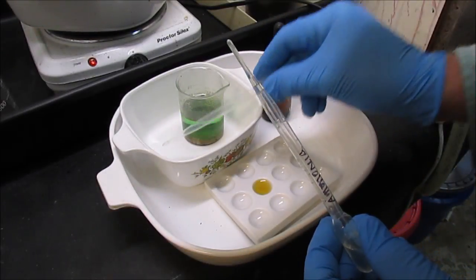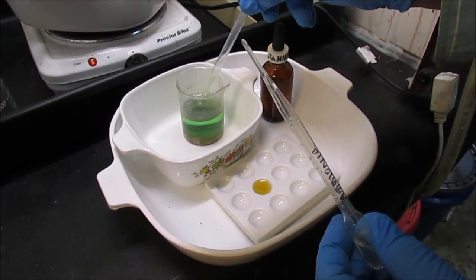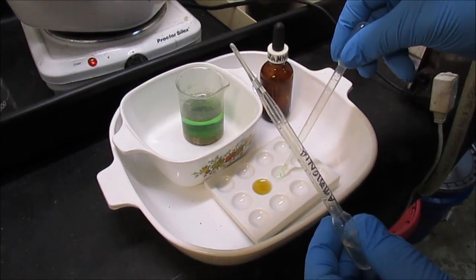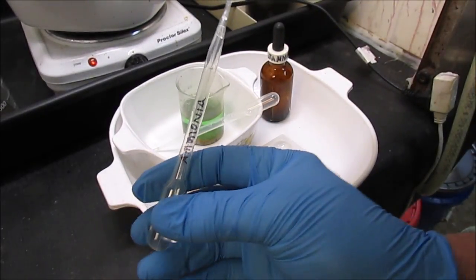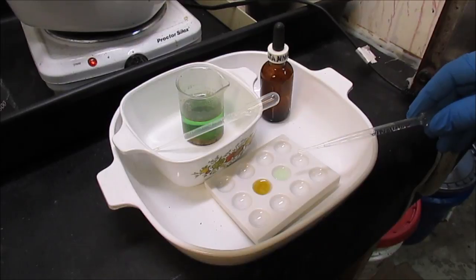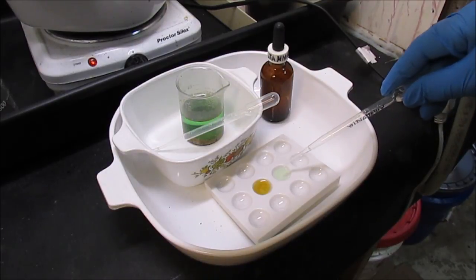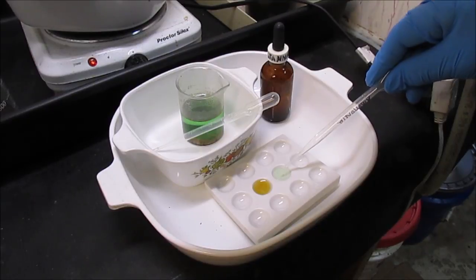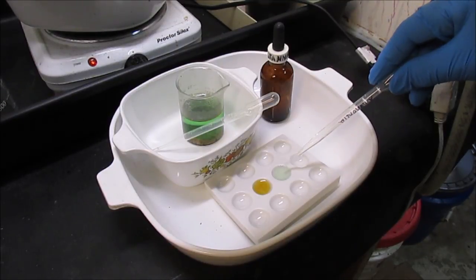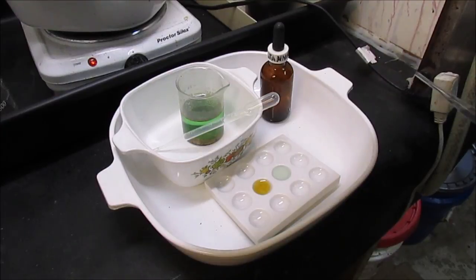Just to see if we got copper going into solution, I'm going to put a little bit of the solution in another spot here. I've got some ammonia, 10% ammonia, and if it's got copper in it, it should turn blue. And it definitely turns blue, so I did put some copper in solution there.